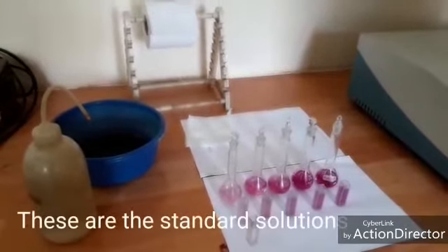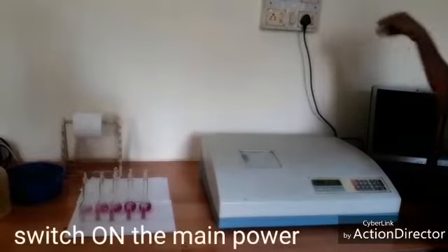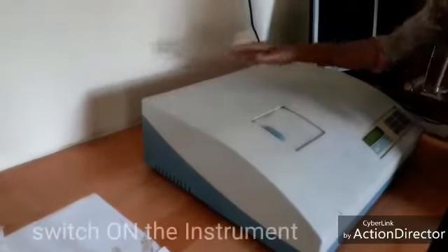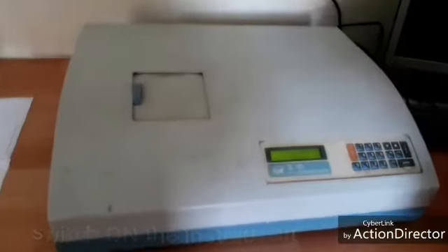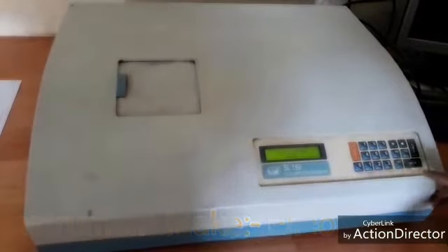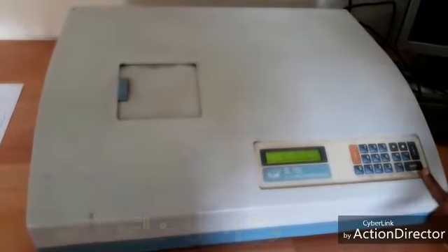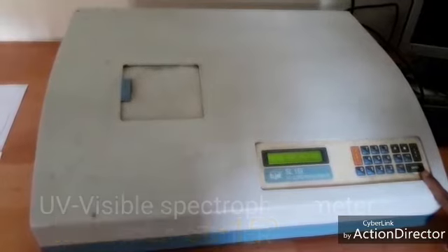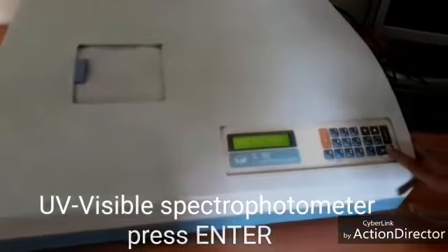These are standard solutions. Switch on the power. Switch on the instrument. Instrument make Elico. Press enter. Model is SL159. This is a UV-visible spectrophotometer. Press enter.